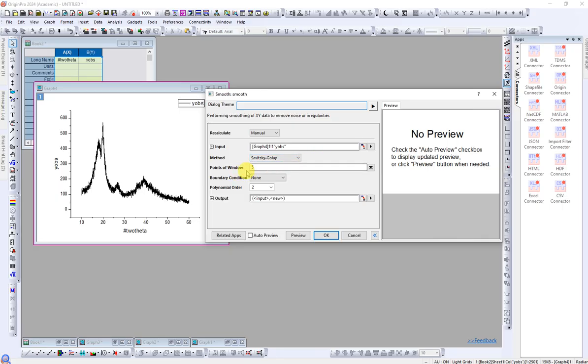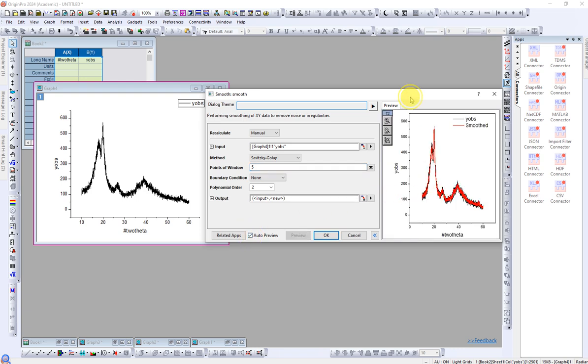And then another one, points of window, you have to change this. You can also change some other factors, but this is important. I will show you how it affects the smoothness of the graph. So by default it's 5. So let's see how it looks when it's 5. So I will click on auto preview. So the graph will look like this.